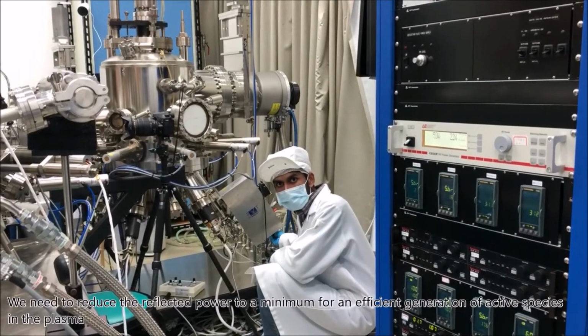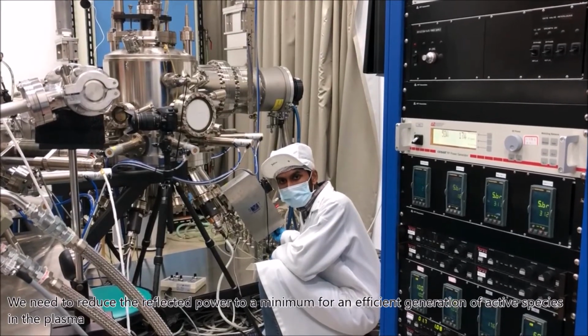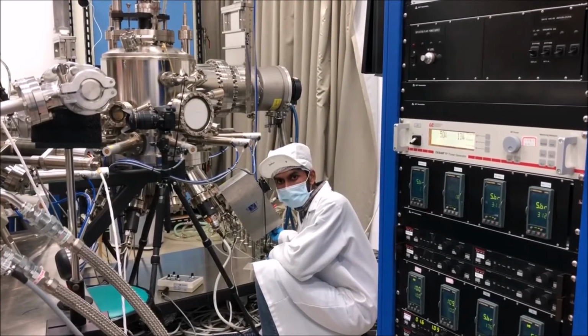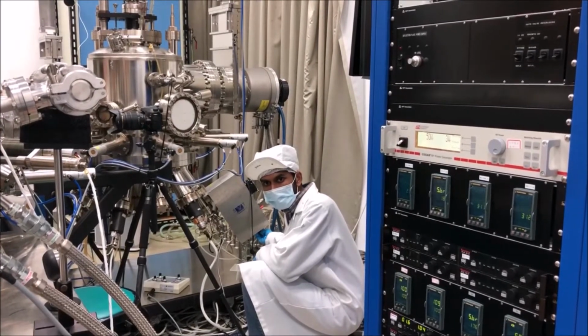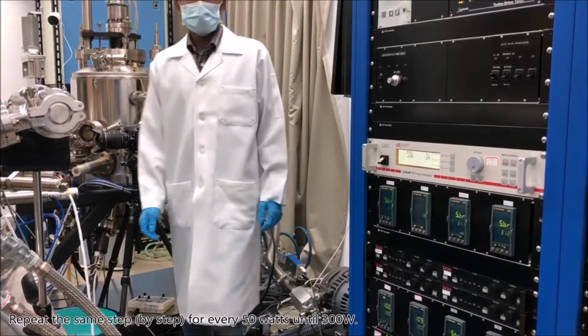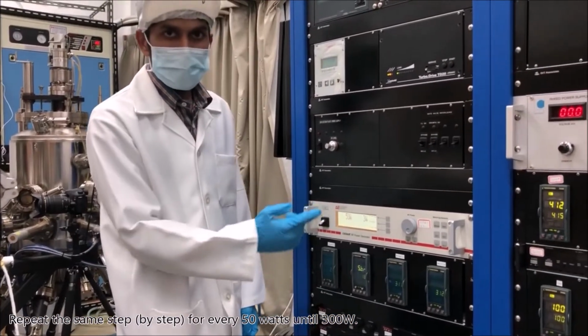We need to reduce the reflected power to a minimum for efficient generation of active species in the plasma. Repeat the same steps for every 50 watts until 300 watts.